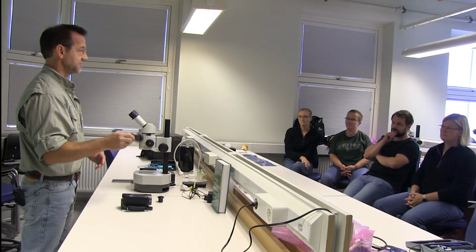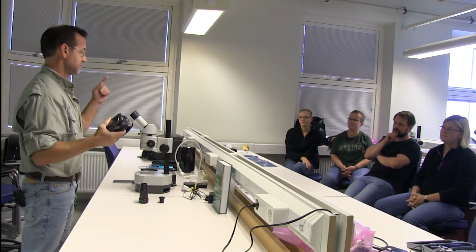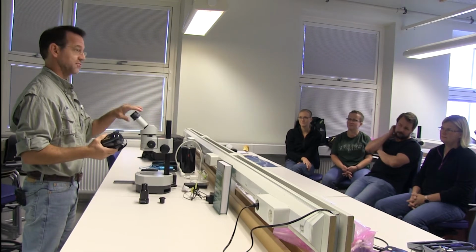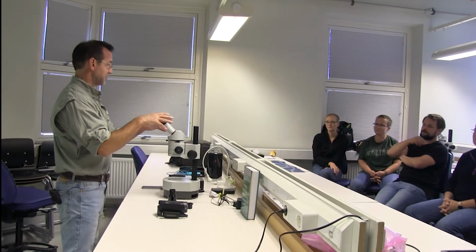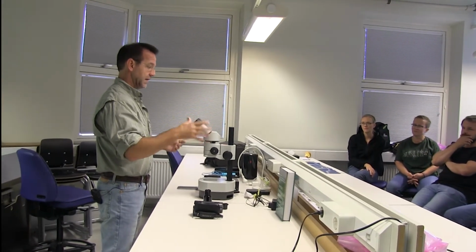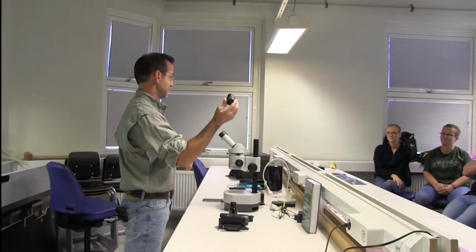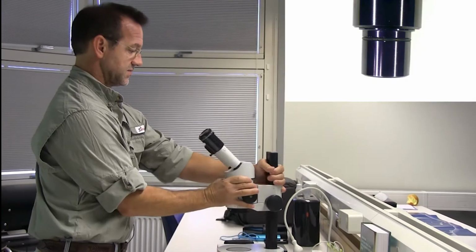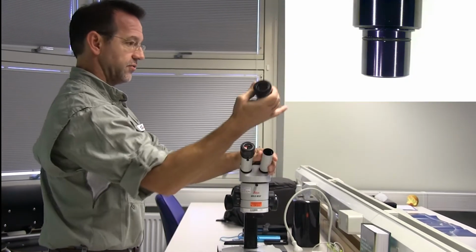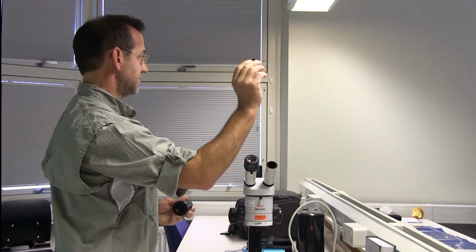This morning we're going to show you some of the technologies used to connect cameras, or video cameras, your phone camera to the microscope. Most of you are familiar with a stereoscope or other type of microscope, and the first thing that you need to do is remove the eyepiece. So that's the key. Most microscope eyepieces are either 30 millimeter or 23 millimeter.